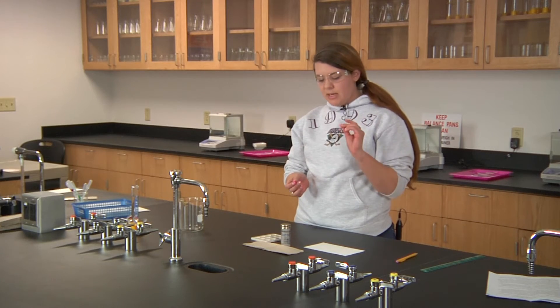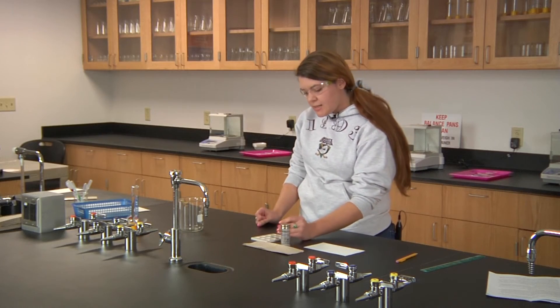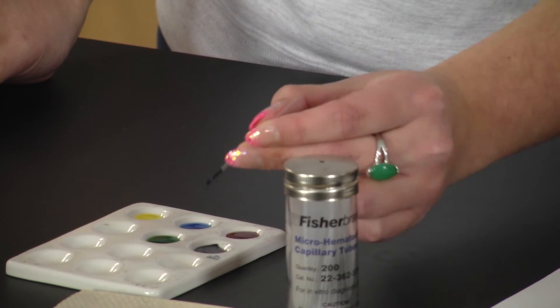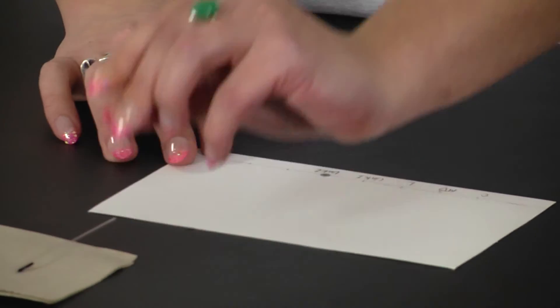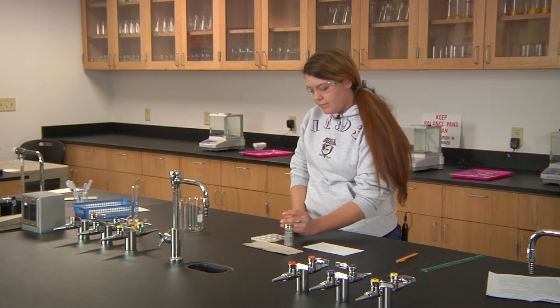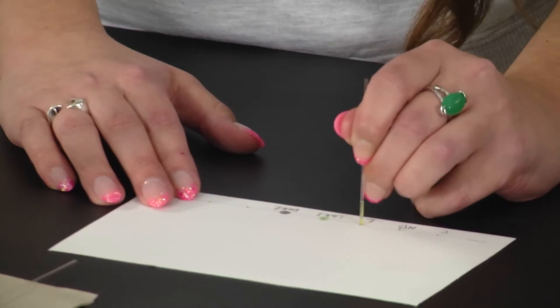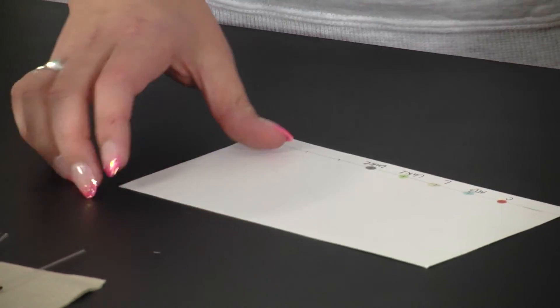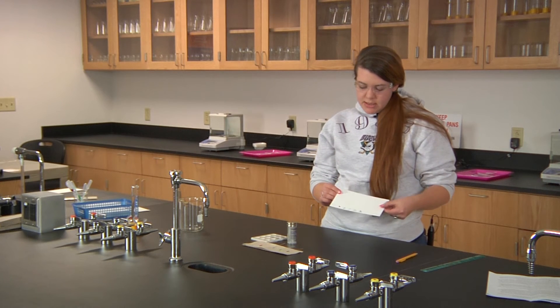Take your capillary tube and put your finger on one end to prevent the liquid from coming up into it, and stir up your sample. Once it's stirred, soak up some of the liquid and place it on the correct spot on the paper. Use a different capillary tube for every sample so you don't mix them together. Do this a total of two times, letting each spot dry in between.